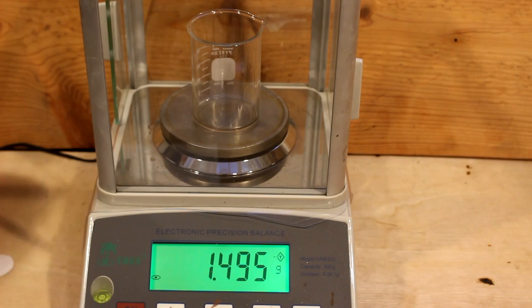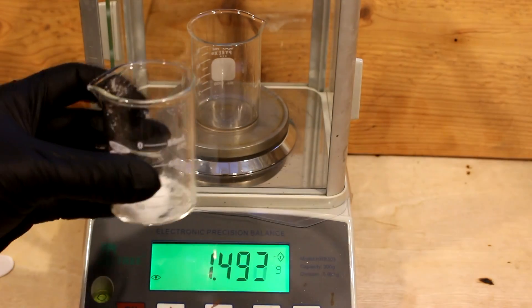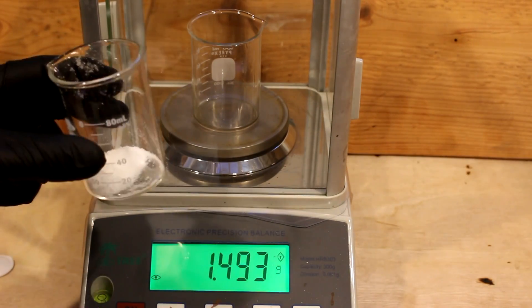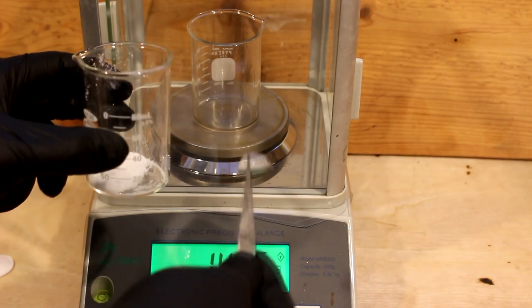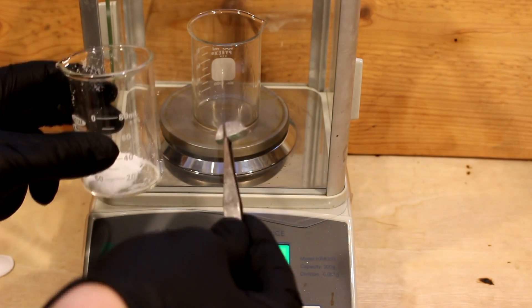Now all I'm going to do is mix them together along with a little bit of water and use this to dissolve my piece of thallium. That could take a while and I think I'm going to do it in an area with a little bit better ventilation.